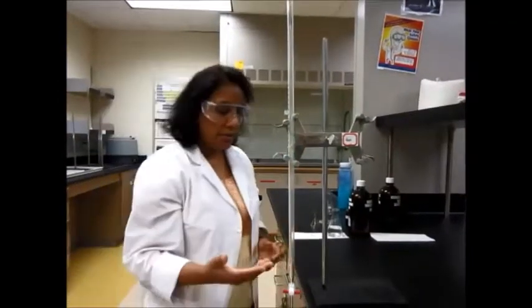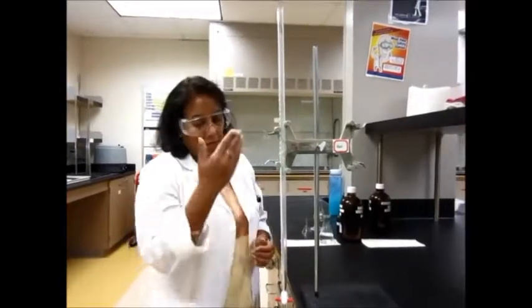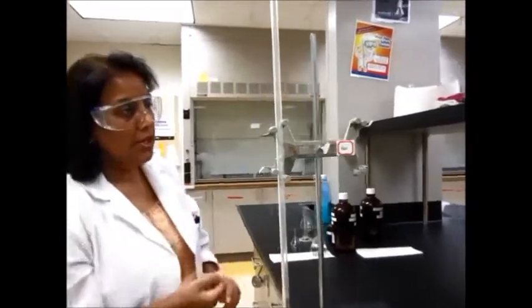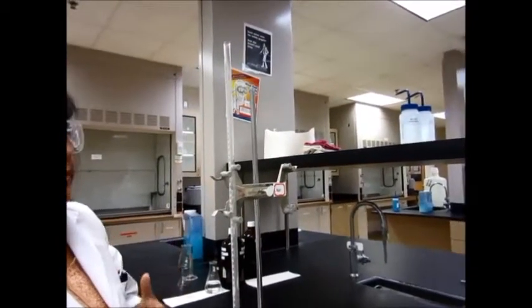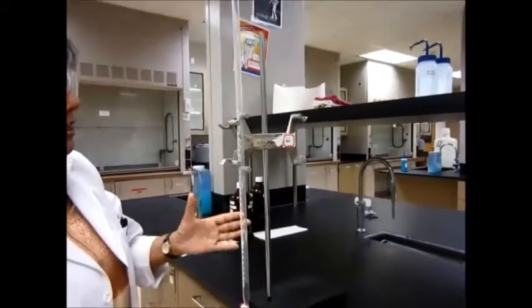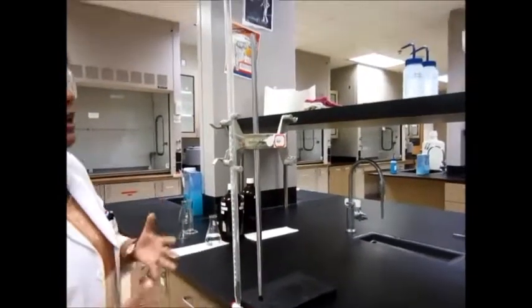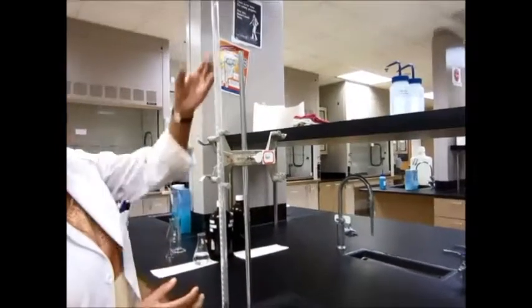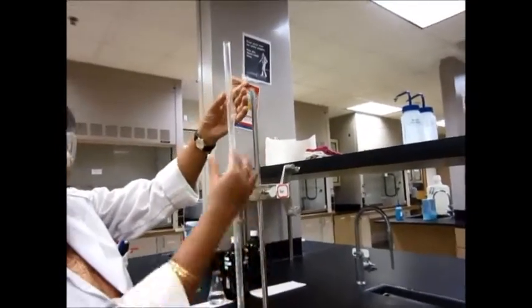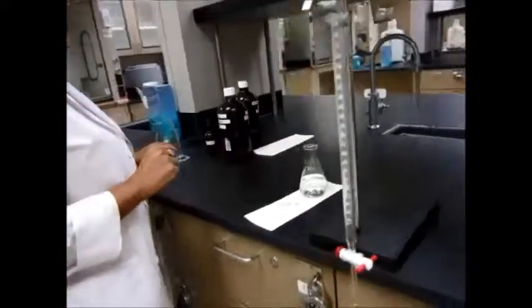There are a couple of things you have to do with a burette. First of all, you have to make sure it's clean. If you cleaned it with distilled water, then the second thing you'll have to do is wash it with whatever liquid you're going to put in here — whether it's sodium hydroxide, hydrochloric acid, or any other solution — so you coat the inside of the burette with that solution. Here I have sodium hydroxide, which is what I'm going to use to wash my burette.